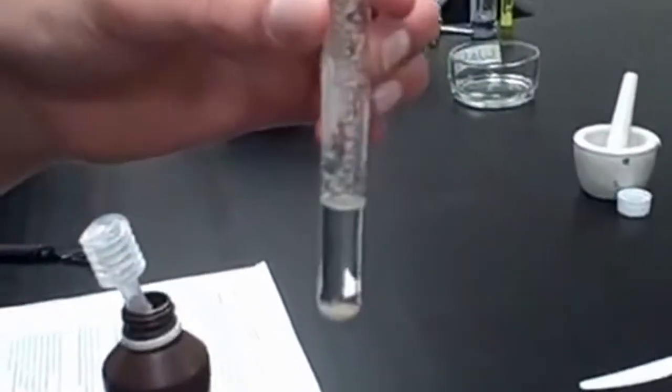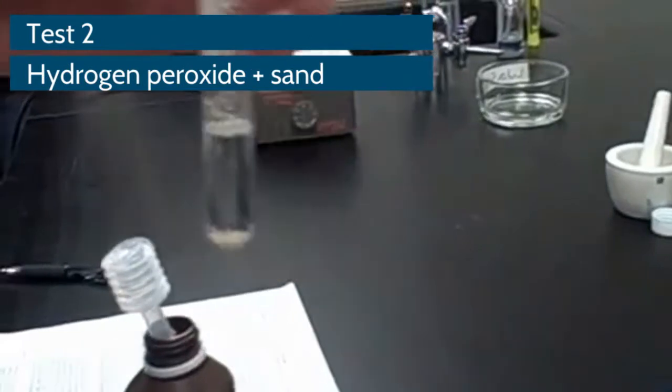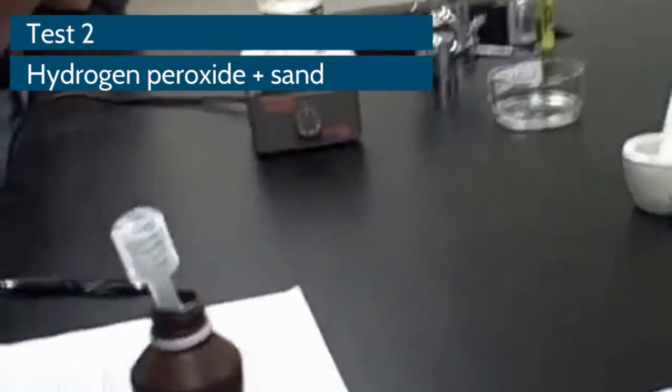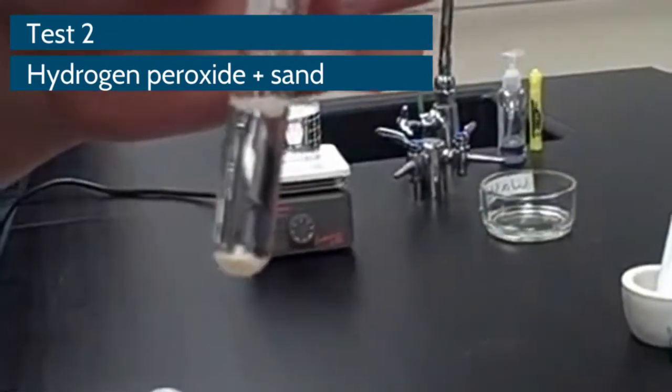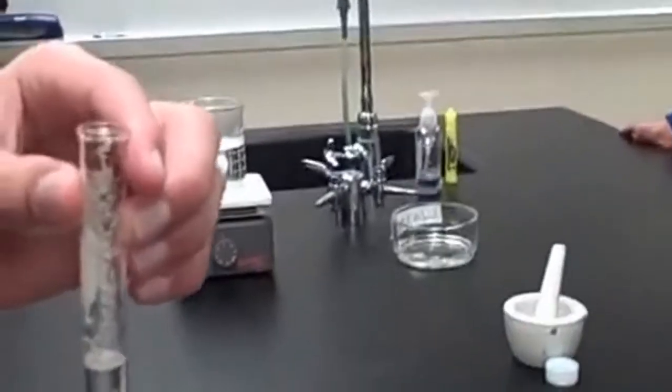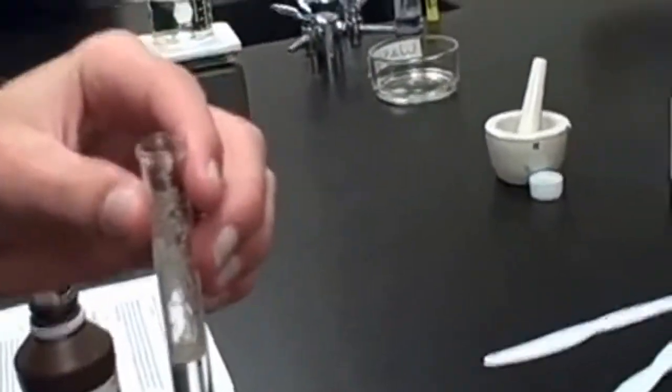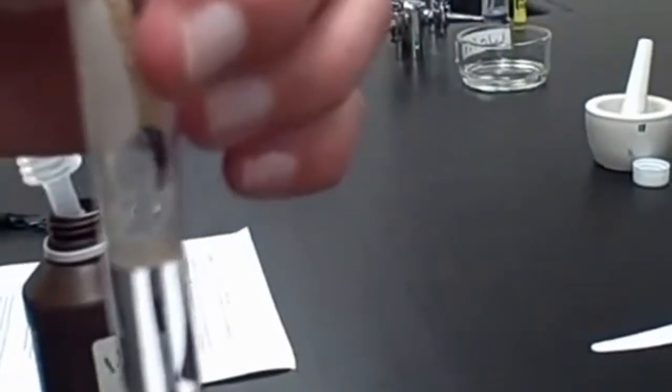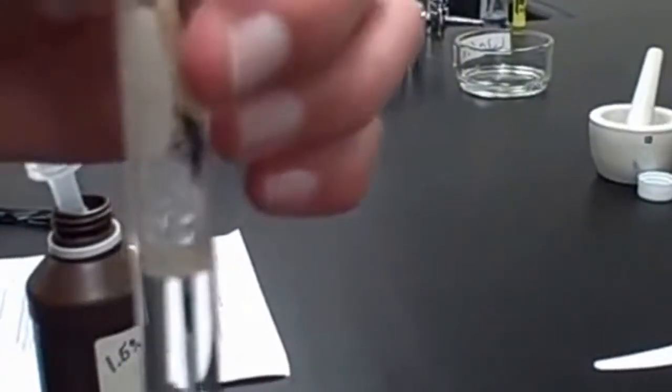Okay, what are we looking at in this tube? The sand and H2O2. Okay, and what do we notice about the tube on the inside right now? The sand is going to the bottom. Okay, all right, let's go ahead and let's try that splint test. That's good right there. You sure? Yep. Okay, that looks good. All right, are we noticing anything this time? No. Okay.